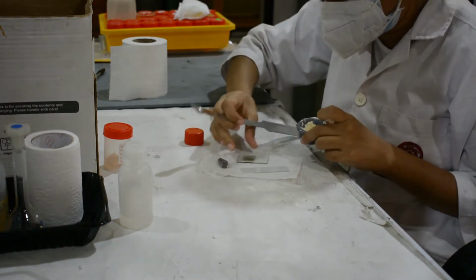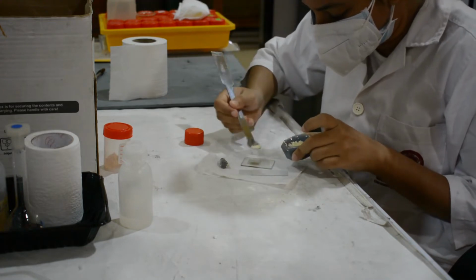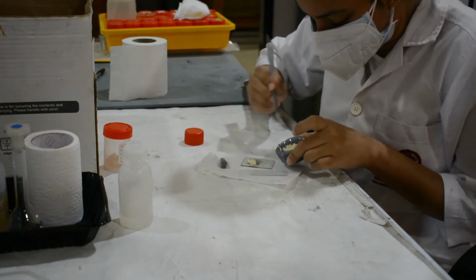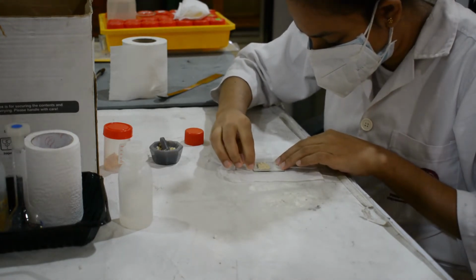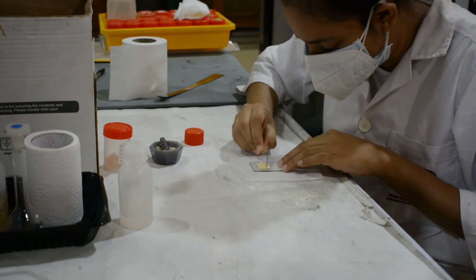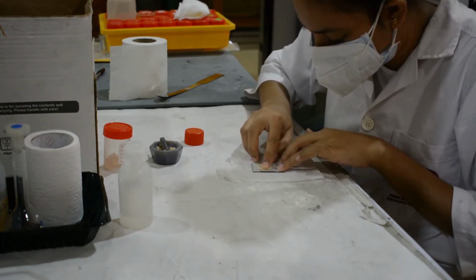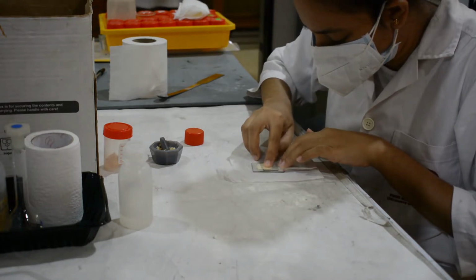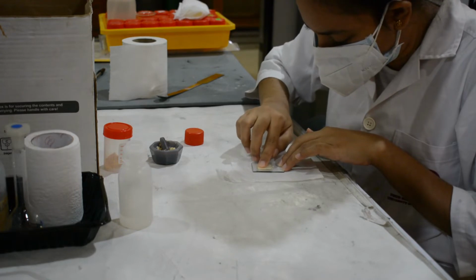Place into a sample holder or onto the sample surface. Smear uniformly onto a glass slide, assuring a flat upper surface. Pack into a sample container. Sprinkle on double sticky tape. Typically the substrate is amorphous to avoid interference.